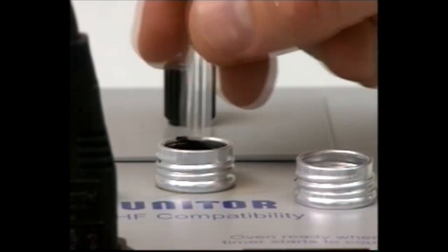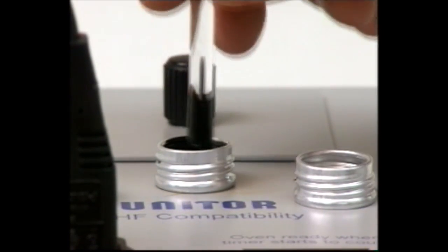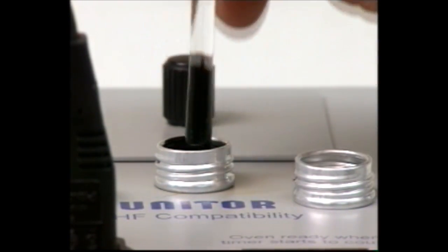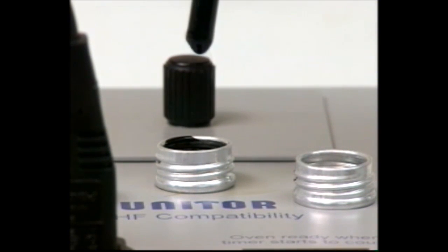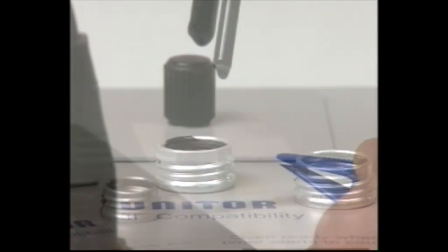Stir the third sample for five seconds, then take a spot sample as before. Spot samples may also be made of the two component oils at this stage if needed.